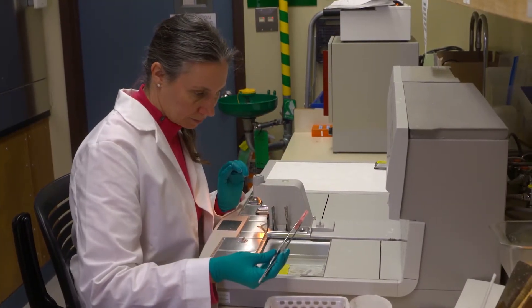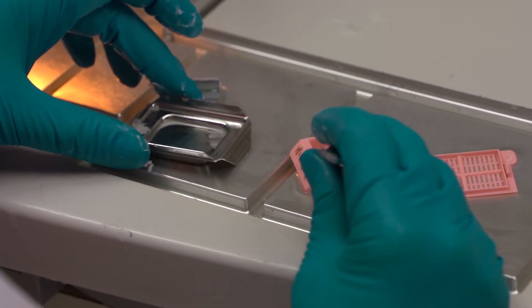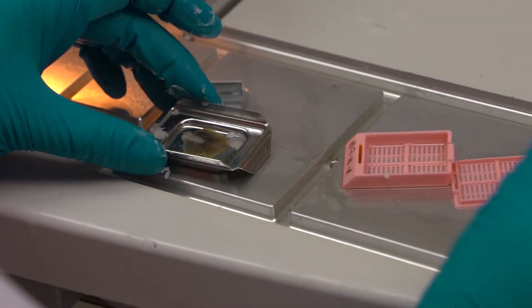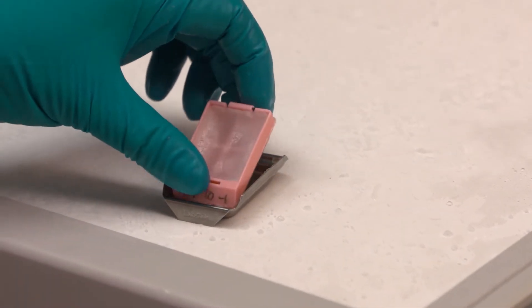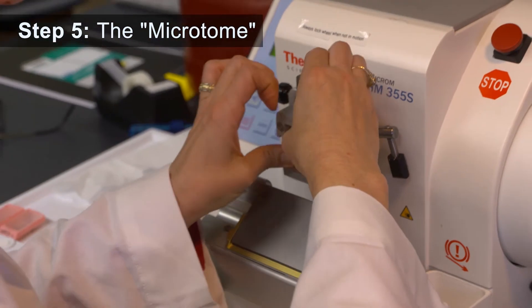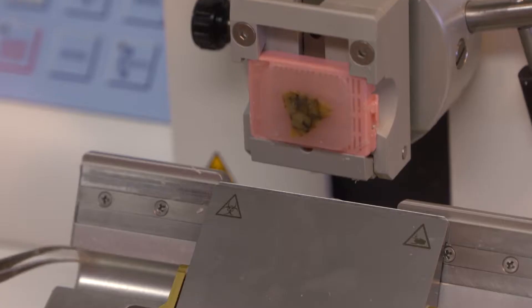Still in its cassette, the sample is embedded in a mold filled with paraffin wax. Once the wax is cool, the sample is placed onto the microtome that slices the sample into ribbons of ultra-thin tissue cross-sections.